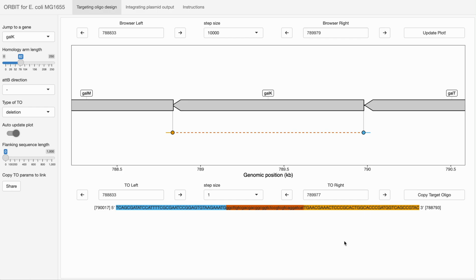We are here again with the Orbit Targeting Oligo Design web app, and I just wanted to bring to your attention a few more advanced issues that you may encounter if you use this genome browser interface extensively.